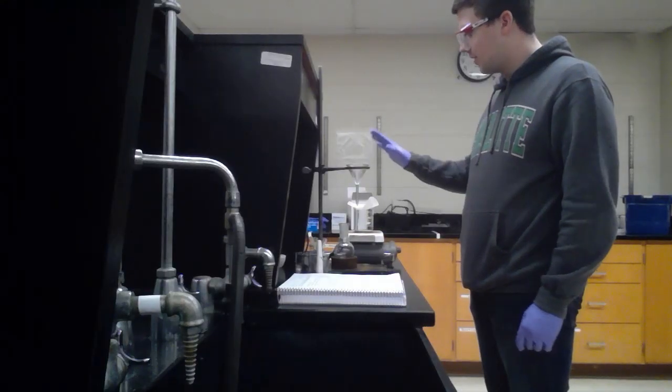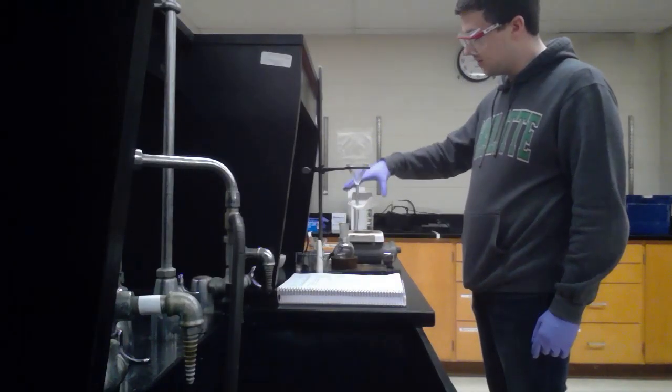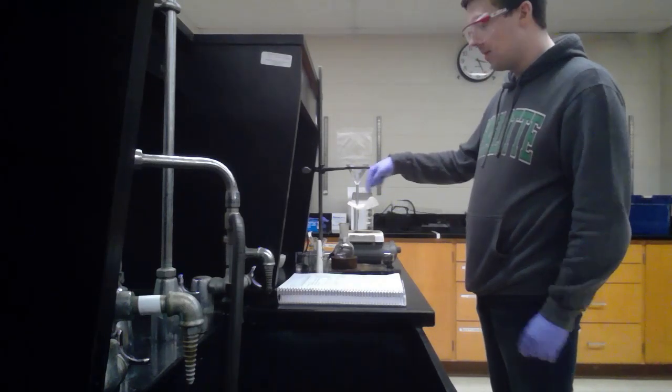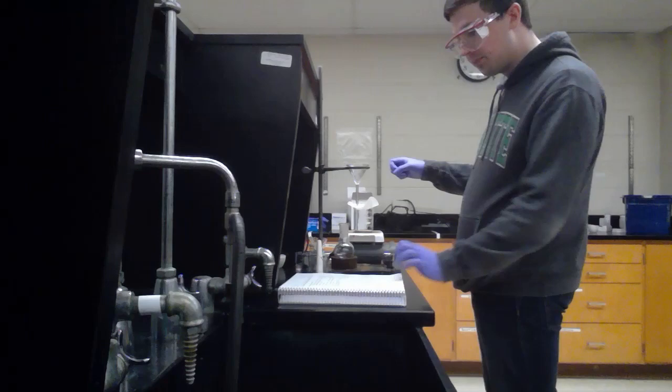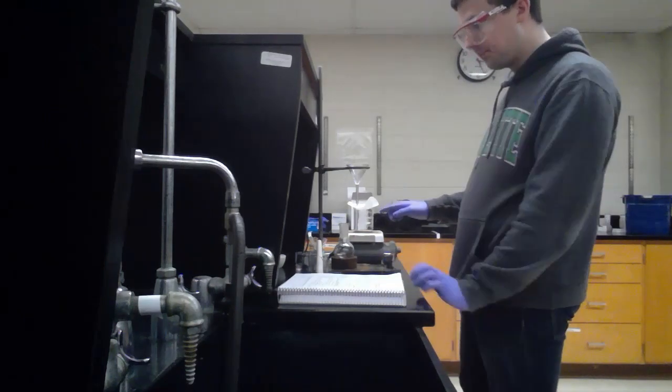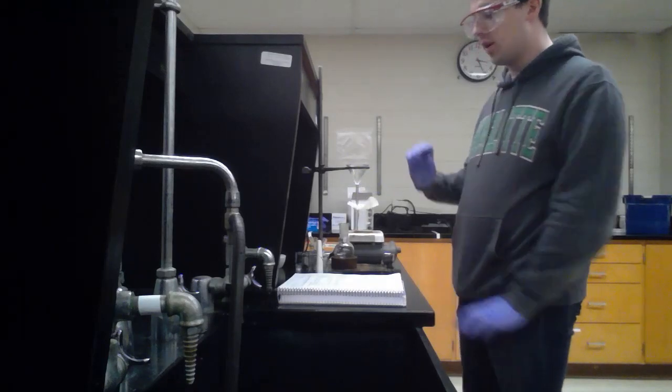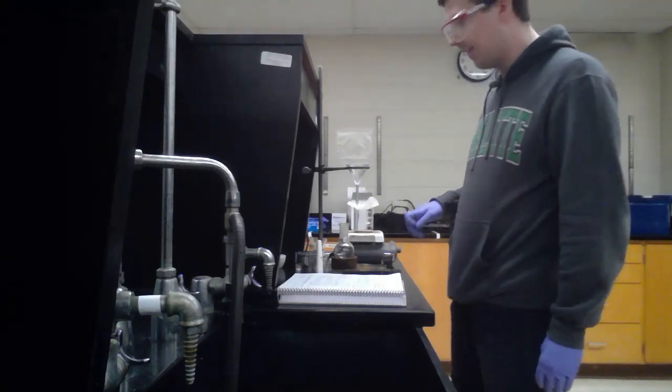Okay, so after we let all this stuff dry, all of this stuff combined, which is your 250 milliliter beaker, your thing that they call the coffee filter, and also the defatted chips, all of that together weighs 103.55 grams.